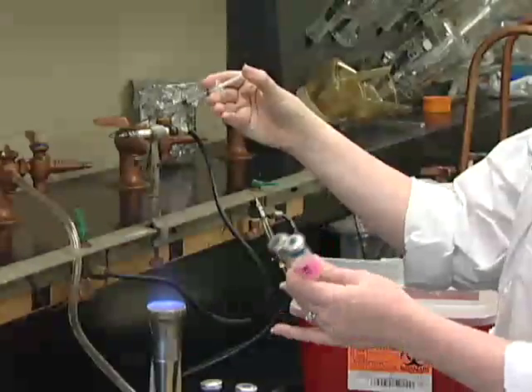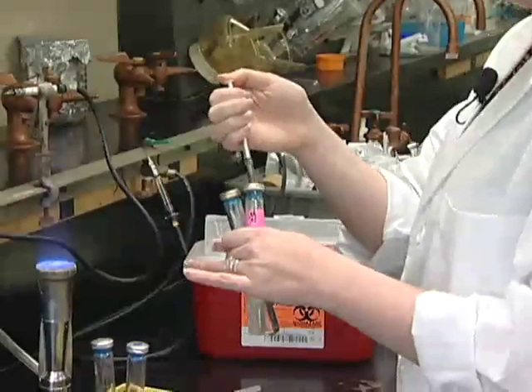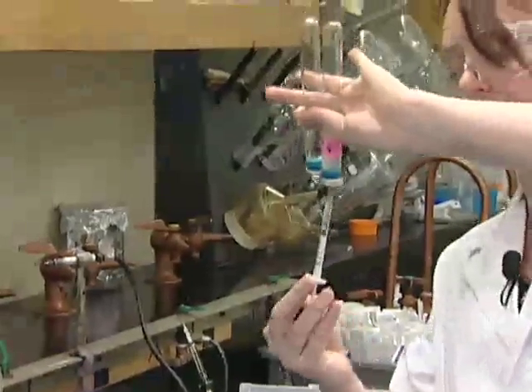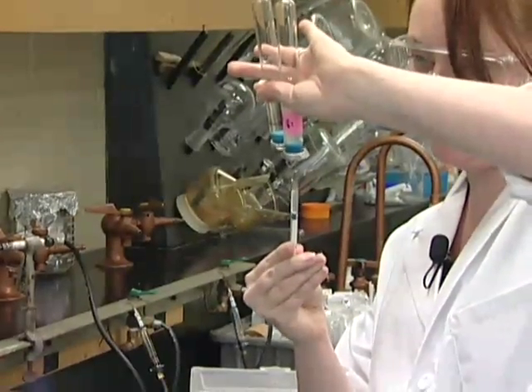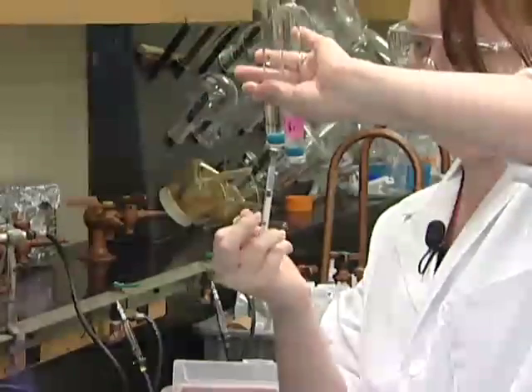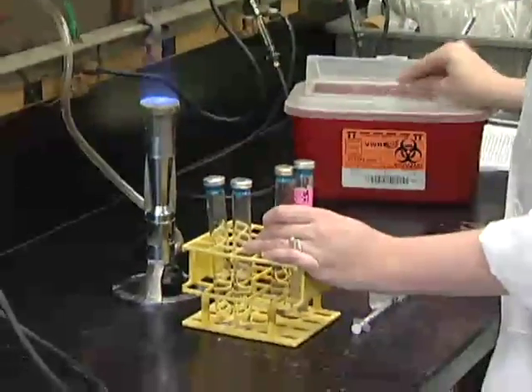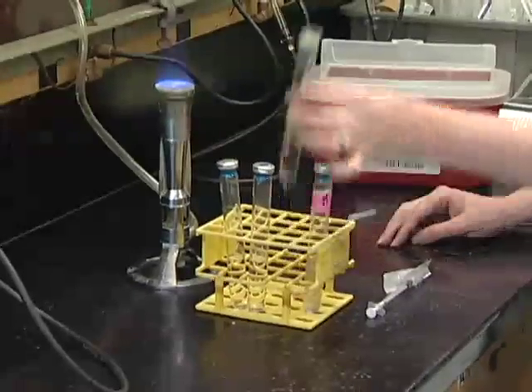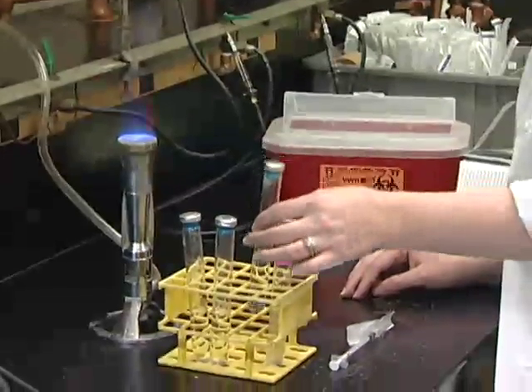So, now that your syringe is ready, you'll go ahead and inject into your already grown up culture. Make sure you hold down the plunger so that it won't shoot up out of the tube, and you will pull out your culture. I'm going to pull this out halfway to make sure that it's not under any pressure. And then I'm going to immediately inject this into my other tube. You'll want to do this quickly and dispose of your needle properly. The quicker you do it, the more likely you are to get a good transfer without any oxygen. If your tube starts to turn pink, then you will know that you have oxygen in there and your culture will most likely be dead or stunted.